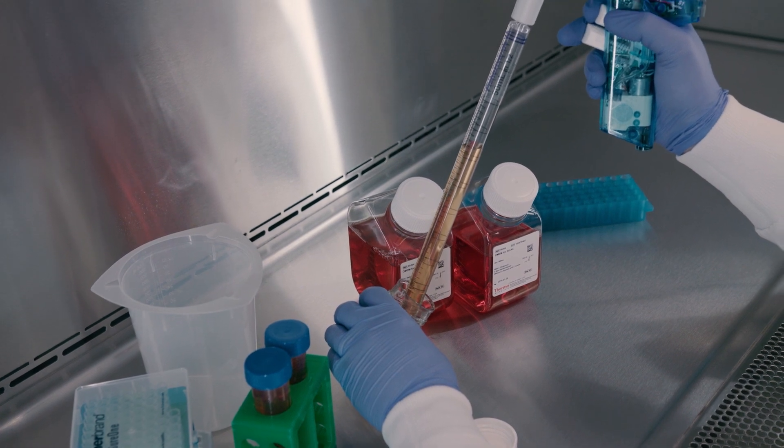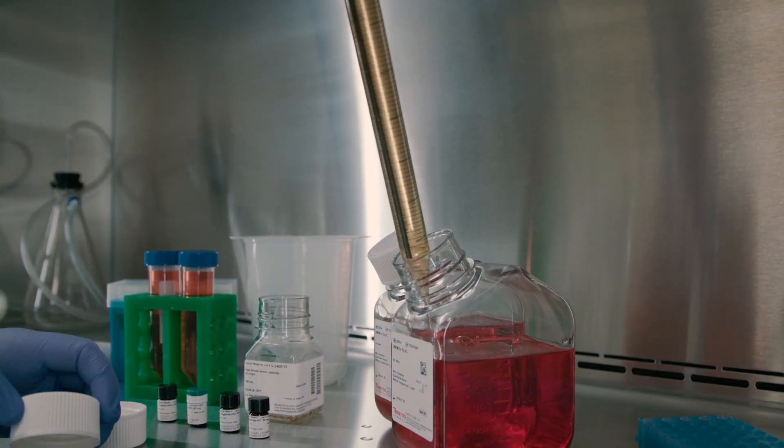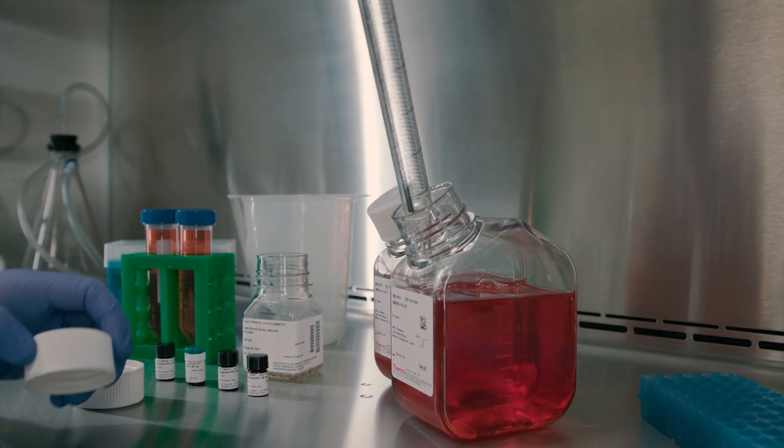As SILAC medium is deficient in both arginine and lysine, both amino acids must be added to the medium to support cell growth.